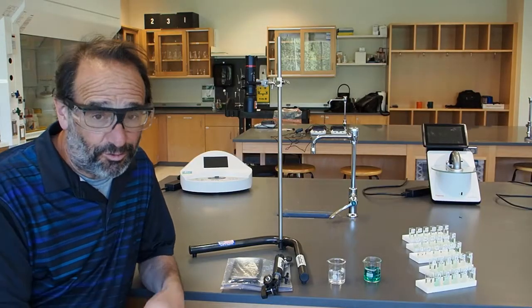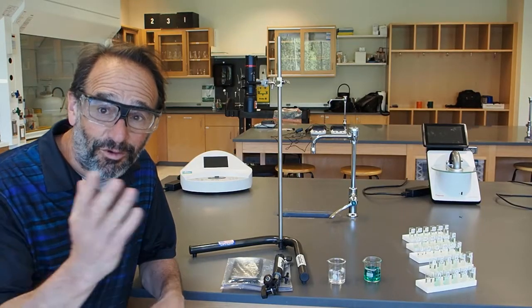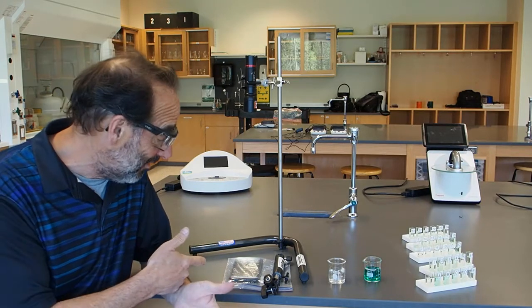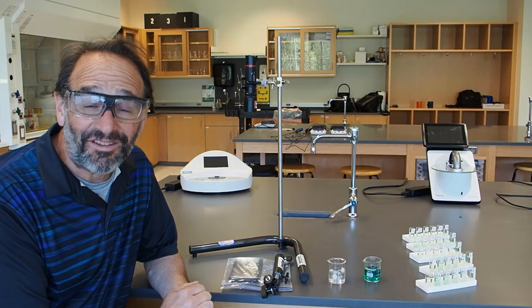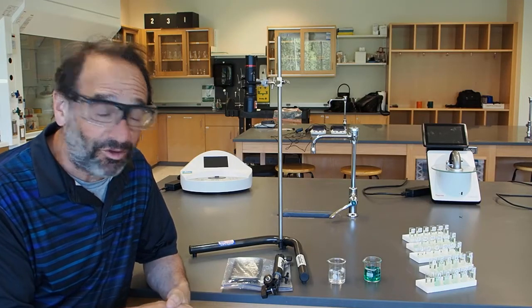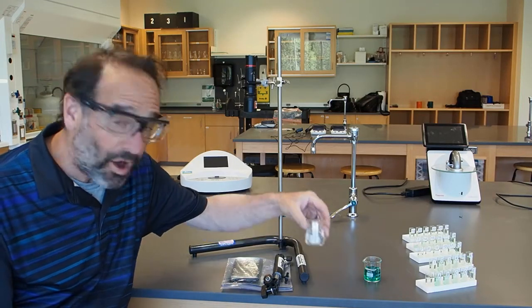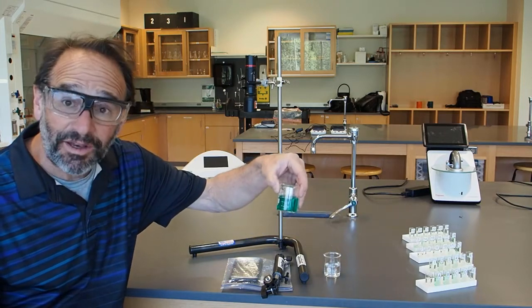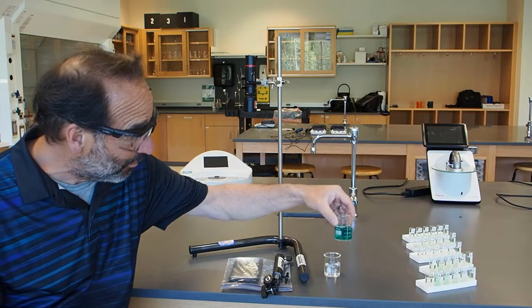Okay, so what we're going to do is what's called a proof of concept test. We're not going to do a full-fledged investigation. We're just going to see if we can see a change in the light intensity using my phone's light sensor based on two different chemical samples. And our two samples are going to be simple: some water and a solution of nickel nitrate hexahydrate that we've been using, but this one a little more concentrated than the ones we were using.